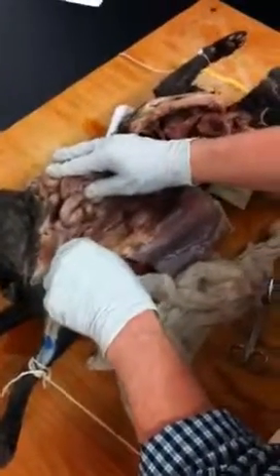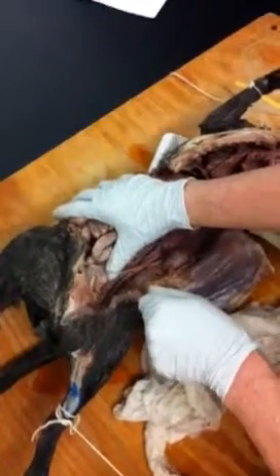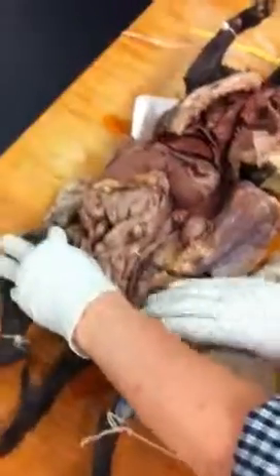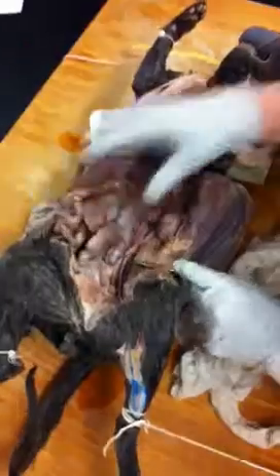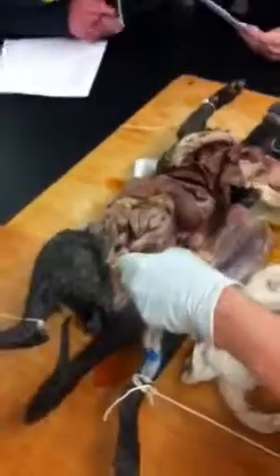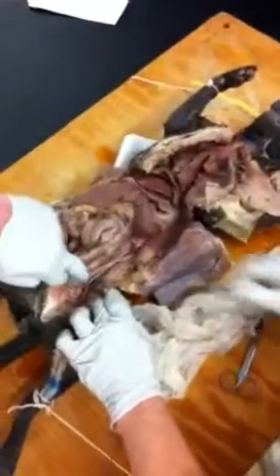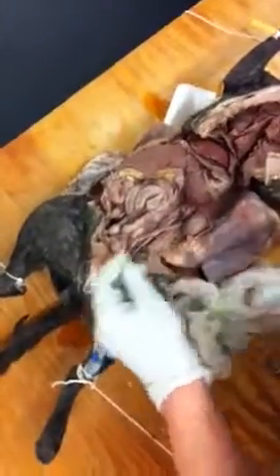So essentially, I'm going to move the ureter out of the way, and as you get down there, you can see here's this single structure that you see right here, still the common carotid. Okay, can you all see that? I mean, I'm sorry, common carotid. Sorry, abdominal aorta. Sorry, common carotid's up here. And then, when it splits down here, you see this Y, and this is where it goes into the iliac artery. See that? So from that Y, it goes into left and right iliac arteries, or is there just one? There's left and right.